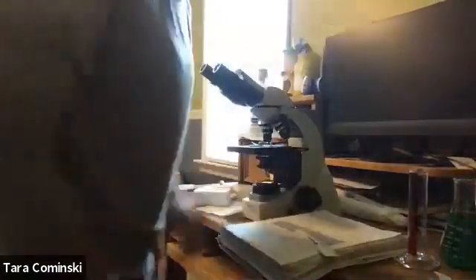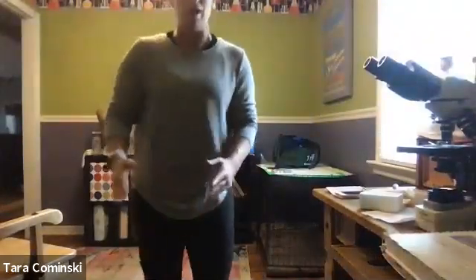Now it's asking you how many centimeters are in a meter. You don't need a meter stick to figure that out, right? I already told you that, and it's also in that table, and you can find it out other ways, but here's your meter stick, right? There are 100 centimeters in a meter, all right? So you guys can fill that in, then it asks you to do another conversion, right?